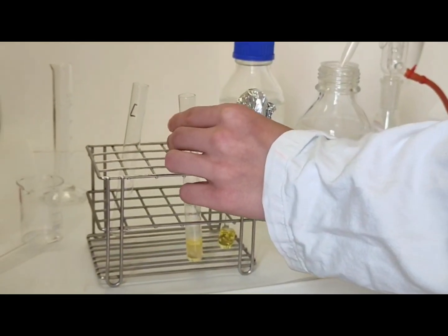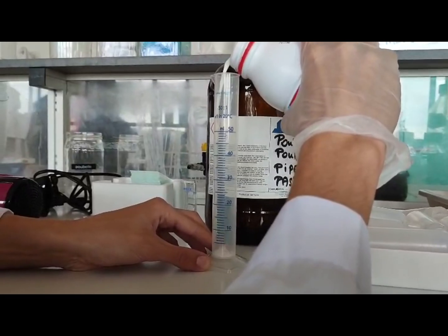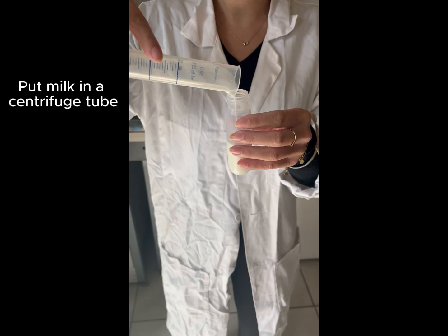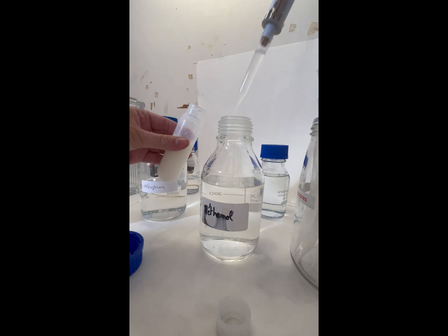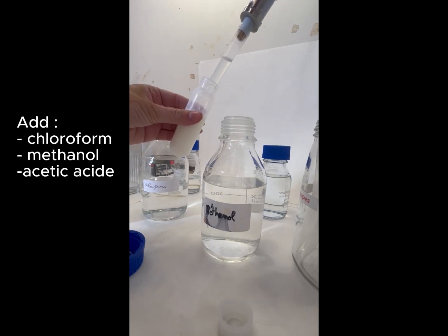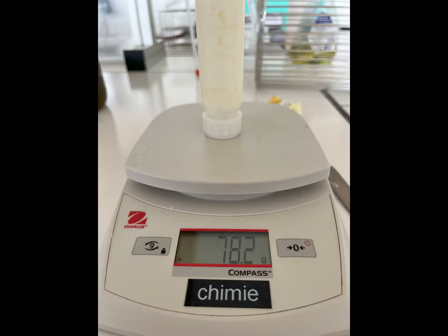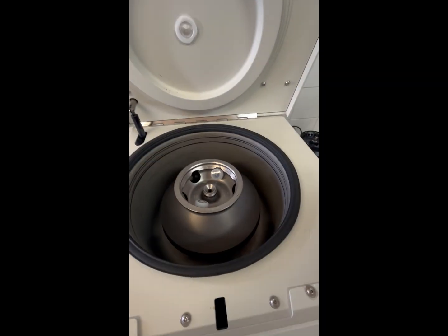We are now going to extract the lipids of the milk. We measure a specific volume of milk and pour it into a centrifuge tube. Chloroform, methanol, and a few drops of acetic acid are added to aid in lipid extraction. To balance the centrifuge, we prepare a second tube filled up with water of the same weight.